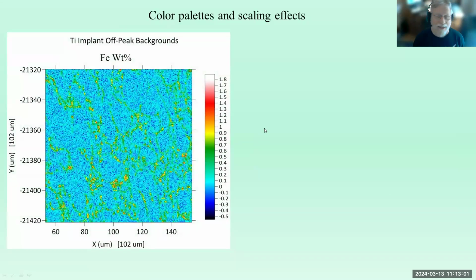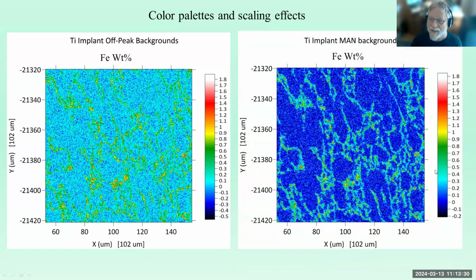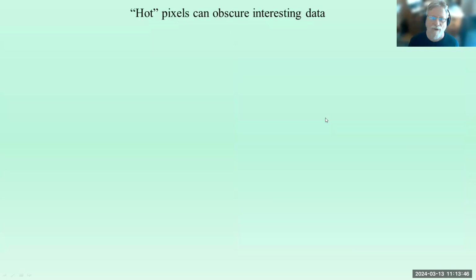And also, this is kind of a point that Anette has made on the forum, which is no more rainbows, because it can be very unintuitive interpreting what's a high and what's a low, depending on if your rainbow has black on both ends, which this one doesn't, fortunately, but it can be problematic. And in fact, it also is just psychologically in terms of the interpretation. So this is iron in a titanium implant, I think a surgical thing. And if we just change the palette just a little bit, we can bring out a completely different effect. So the palette choice does matter. That's up to you, but it's important to emphasize the things that are important.